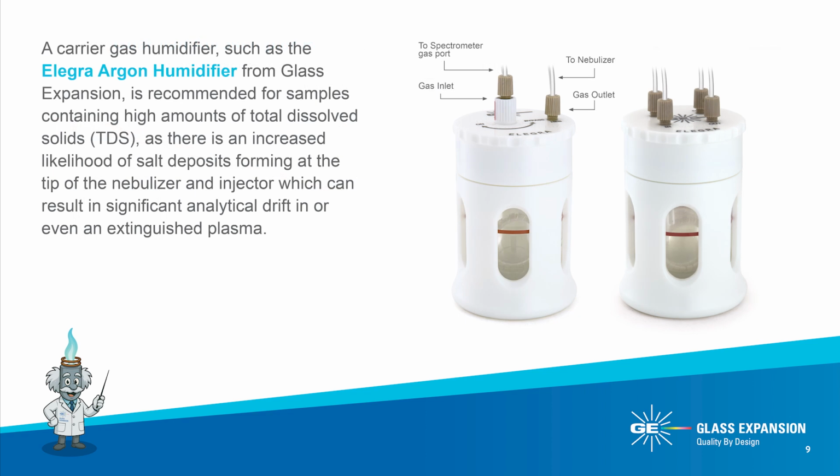The other common type of blockage is salt deposition at the nebulizer tip, a frequent headache with high matrix samples. That's where an argon humidifier comes in, which is typically essential for these types of samples. Glass Expansion's Elegra Argon Humidifier is a compact, entirely inert design with no metal fittings, and is neither pressurized nor requires any power. It delivers approximately 95% relative humidity, reducing salt buildup, stabilizing your signal, and extending the life of your nebulizer, torch, and interface cones.